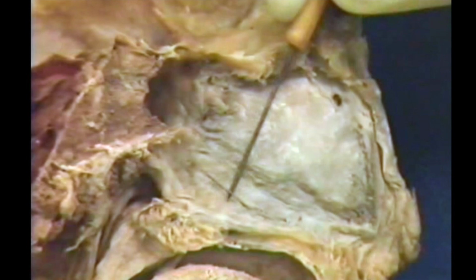At this point, the nasal septum needs to be cut away to demonstrate the lateral wall of the nasal cavity. However, before doing so, look for the nasopalatine nerve deep to the mucosa at the level of the vomer. Realize also that we do not see the olfactory nerves in the nasal cavity. They are microscopic. But be aware that the olfactory epithelium, that is, where we respond to smell, is just inferior to the ethmoid bone.